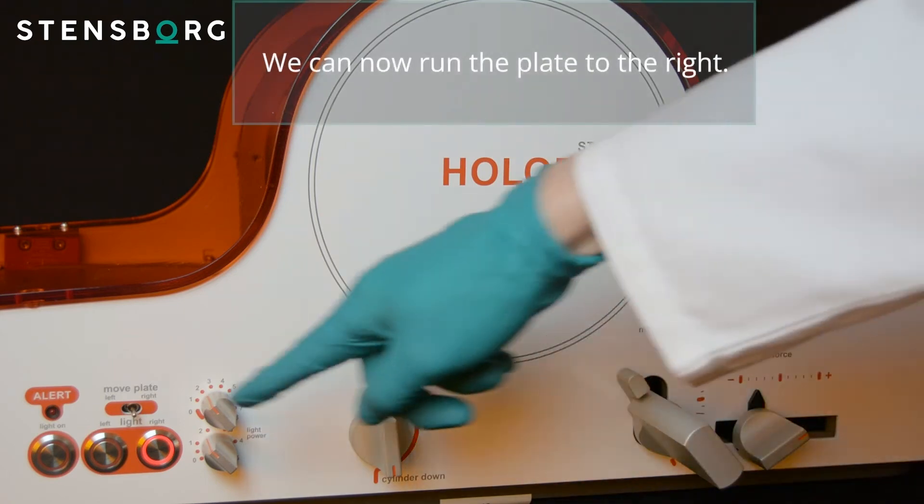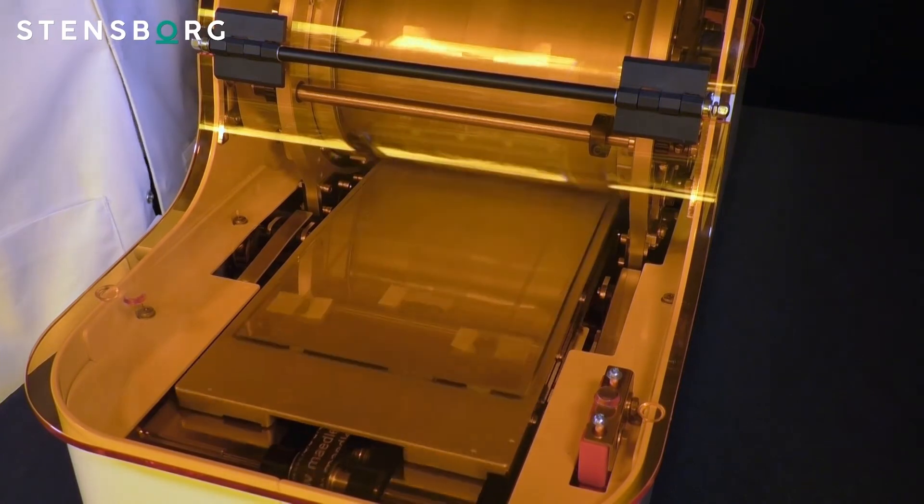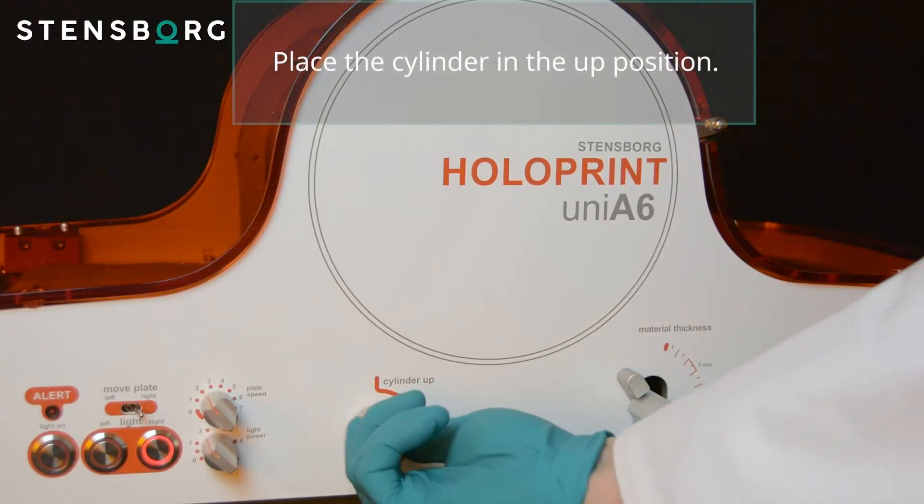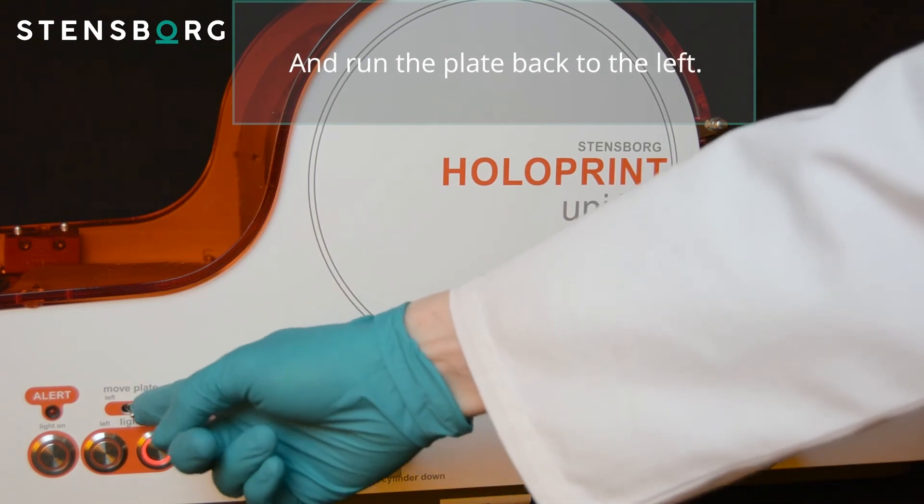We can now run the plate to the right. Place the cylinder in the up position and run the plate back to the left.